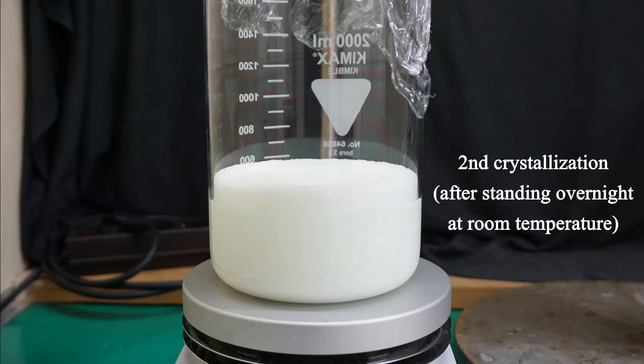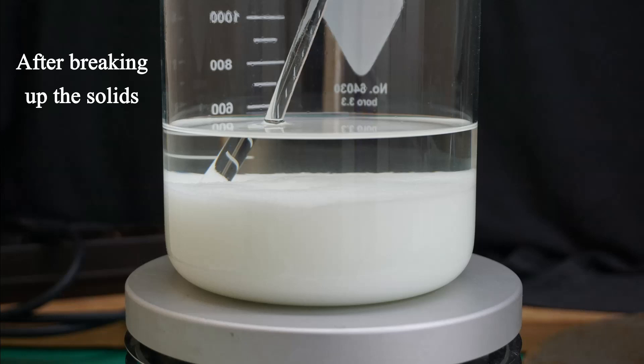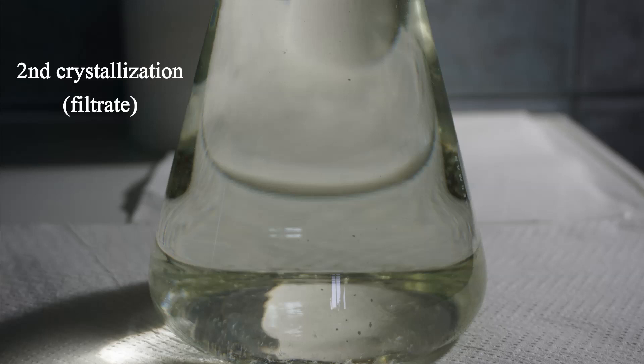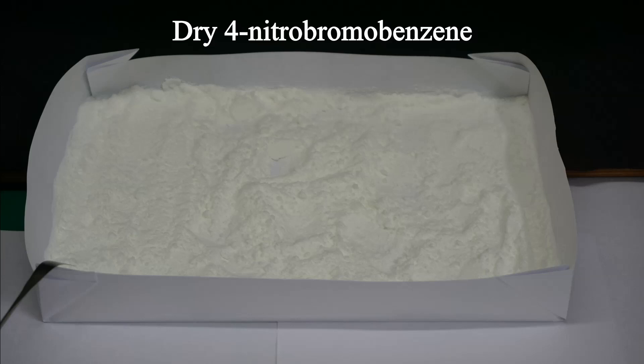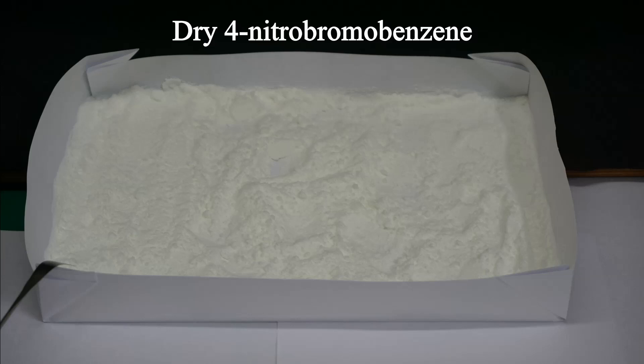The next day I filtered the suspension and washed the solids on the Buchner funnel with 50 ml of fresh 96% ethanol. The product was then spread out on some paper and left to dry for 2 days. What you see here is the dry product. I got 74.6 grams of dry 4-nitrobromobenzene, representing a 39% yield based on the bromobenzene used.